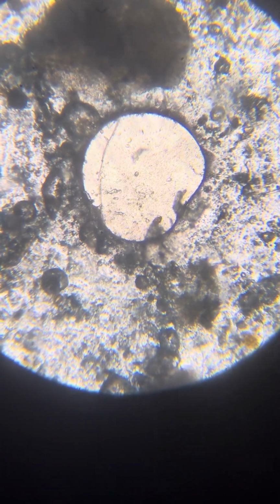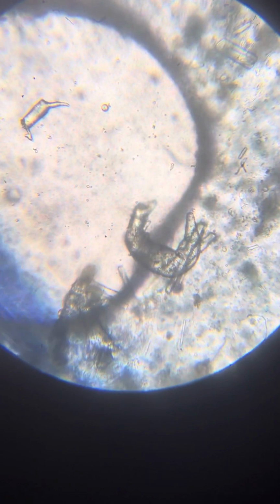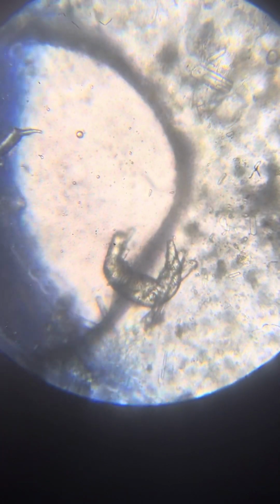So we see very nice things, actually, and also a flow. Maybe we should zoom in. This is 150. We see a shrimp life form, which is very interesting, and the flow mixture, and several Neos which are one on top of the other, in different layers, like for the material. This shrimp is very nice.